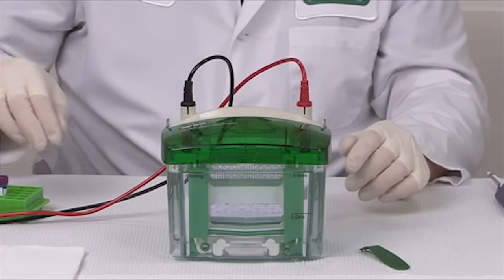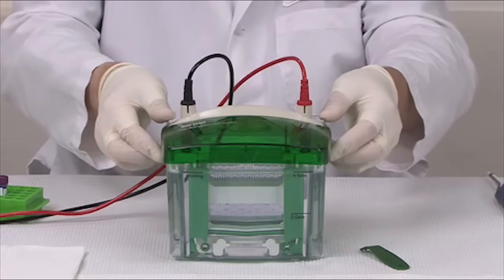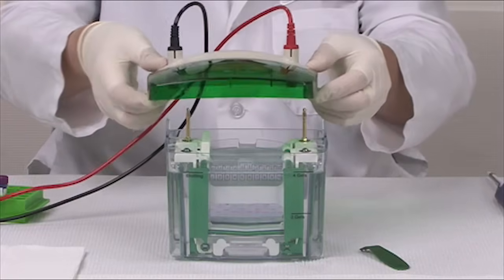After the run is complete, turn off the PowerPak power supply, remove the leads, and remove the TetraCell lid.